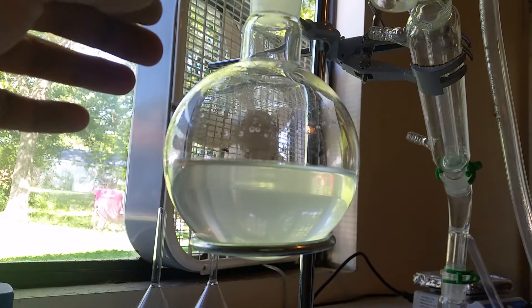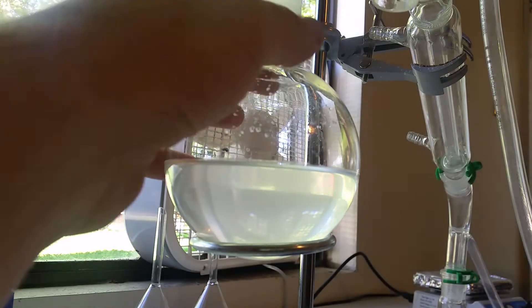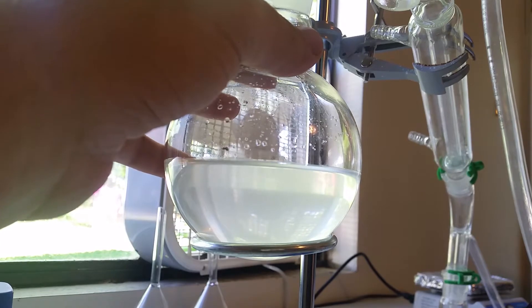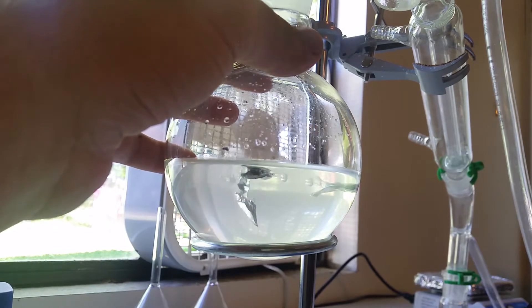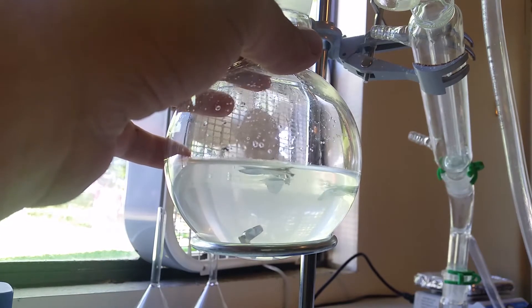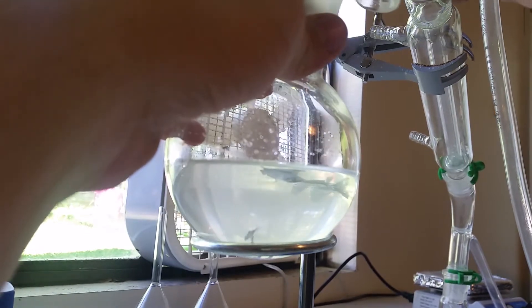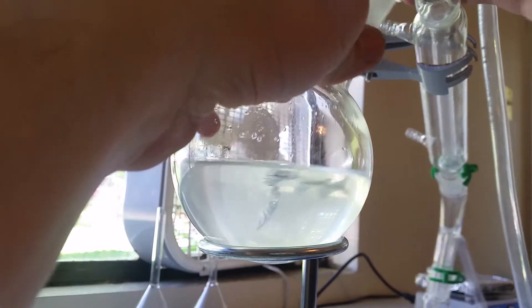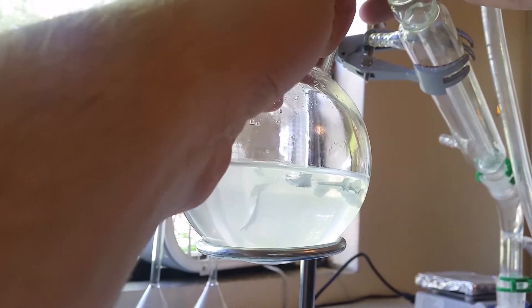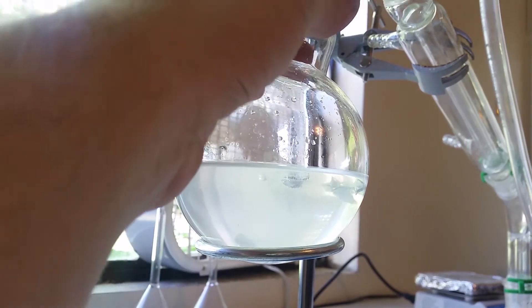Okay, so I have the sodium hydroxide solution in the round bottom flask and I'm going to add some aluminum and then hurry up and put the distillation apparatus together. We don't need to go in too vigorously. I mean, there's not a whole lot of area inside of that jar.